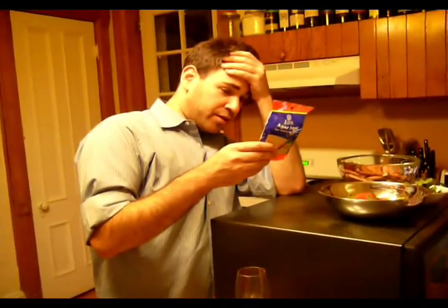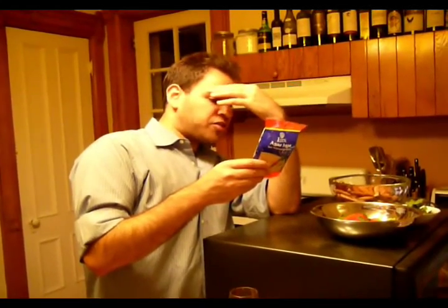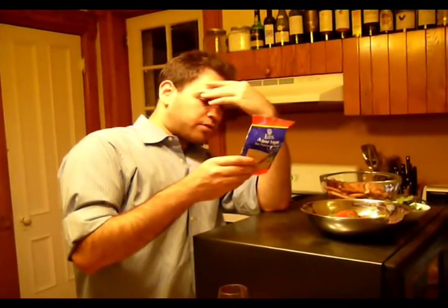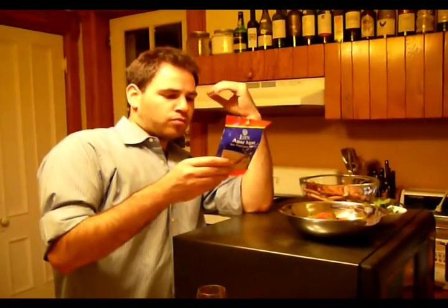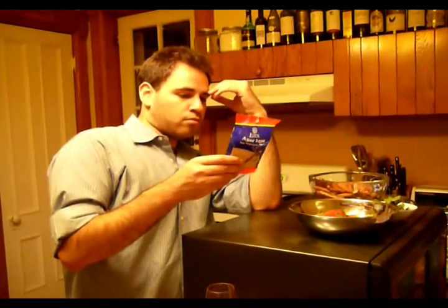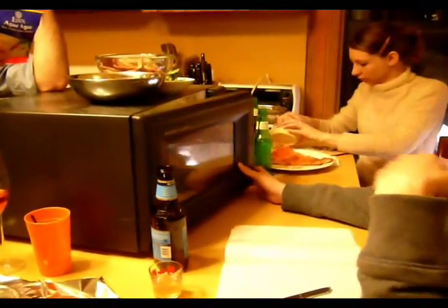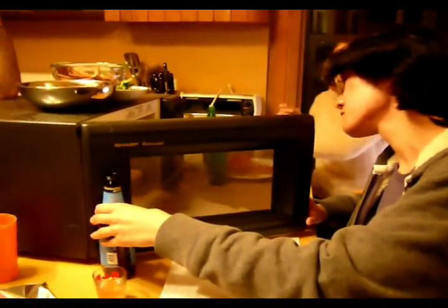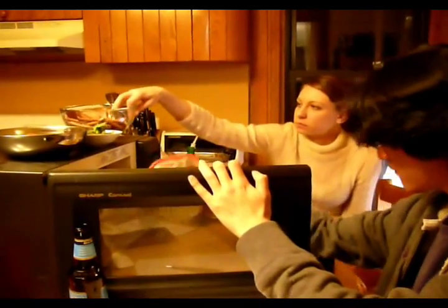Bring it to a boil. Maybe it's a boiler — that's what we're doing in the microwave, I hope. How long are you supposed to boil it? You have to reduce heat and simmer five minutes or until dissolved. Well, we've boiled it a lot. That's four tablespoons and four cups, though, and this is like half a cup. Watch out, it's going to be burning real hot. We have the hot towel. It's supposed to dissolve. We can also just take it to a pot.